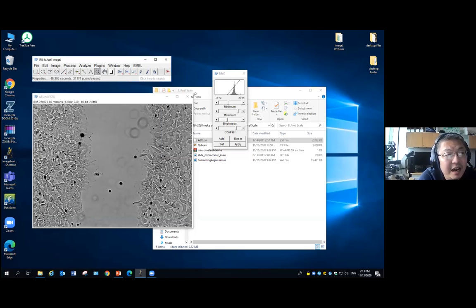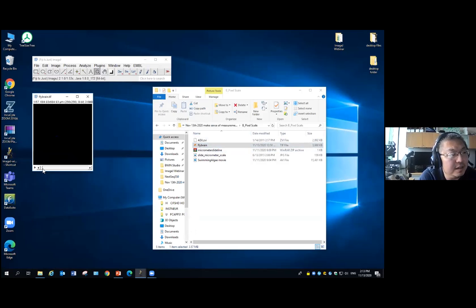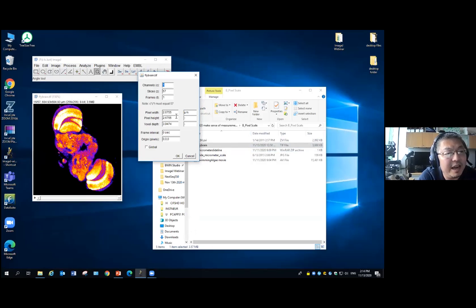But by far, I haven't seen any case that ImageJ read it wrong. Like for this one, the Flybrain, open it. This is actually a 3D stack, a Z-stack image, a fluorescence image of a Flybrain. If you go to the properties, it not only gives you the X and Y, it also gives you the Z. So when you do Z stacks, what step do you use to ask the microscope to move in each slice? It's about 4 microns.